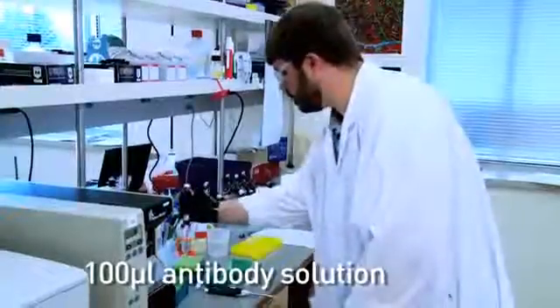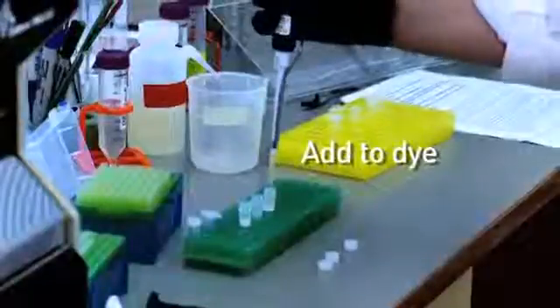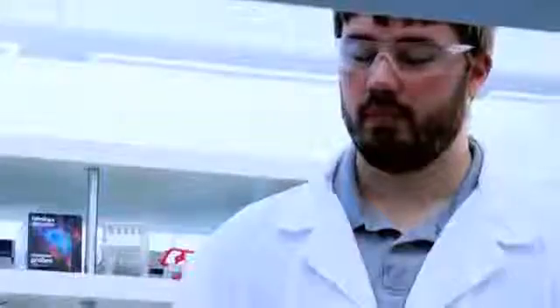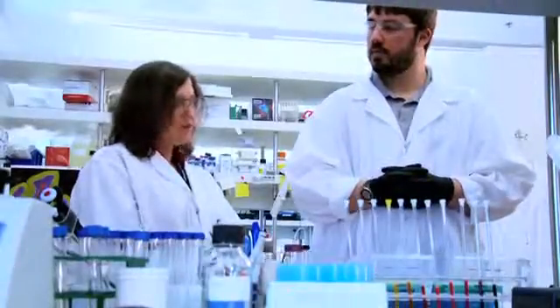And that's done. So basically within the first minute this reaction is complete, but we're gonna let it go like 15 minutes. Our protocol says you can go for up to an hour, but 15 minutes is gonna be sufficient.